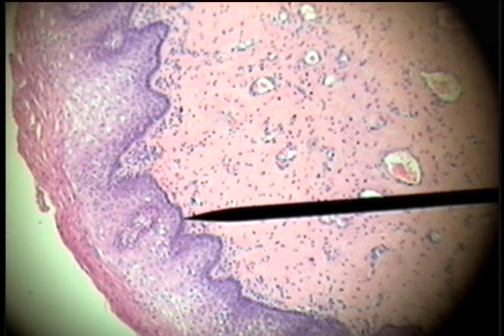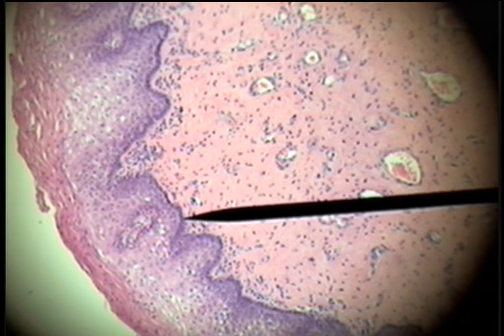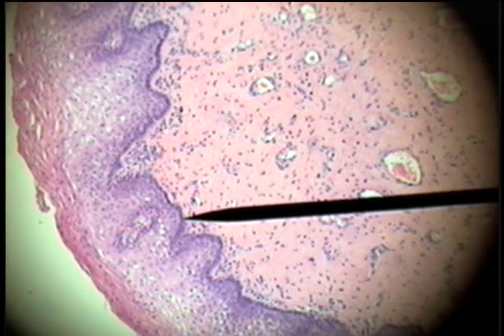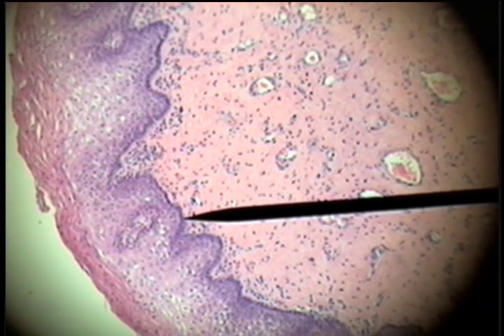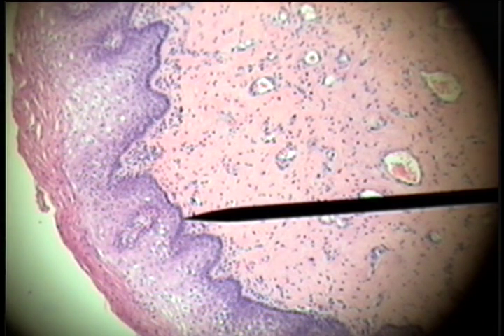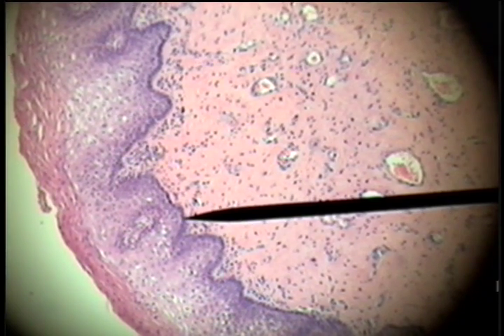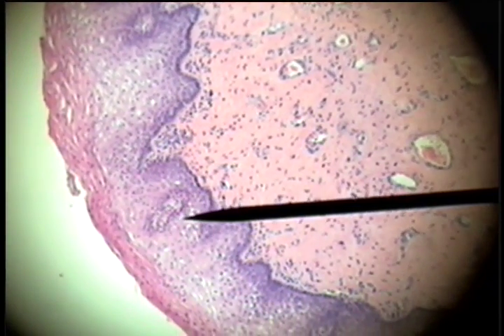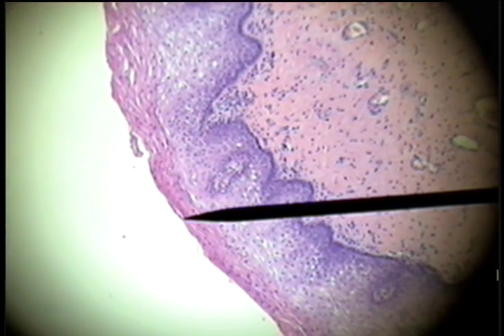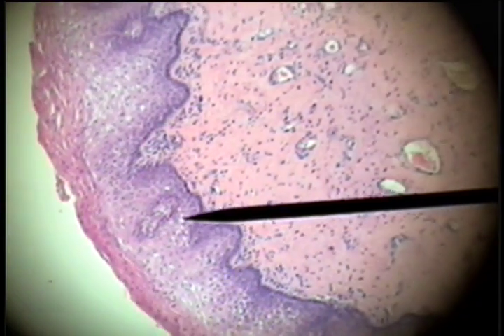Another example of layered epithelium is stratified squamous non-keratinized epithelium. The previous slide was from the esophagus. Another organ is the vagina. Here's the basement membrane and the cells of the lower layer that tend to be oval, round, cuboidal, but as they approach the surface they become flattened or plate-like — layered stratified squamous.